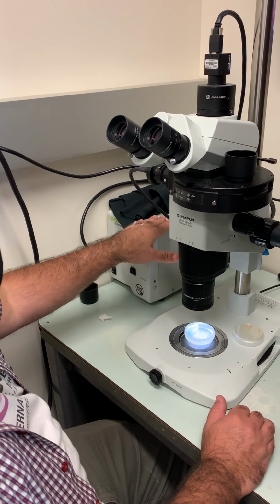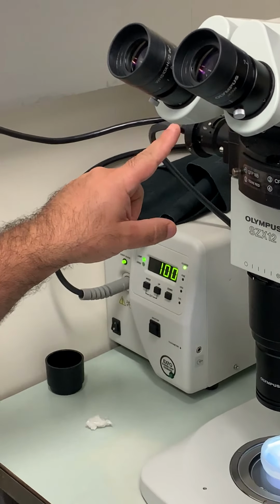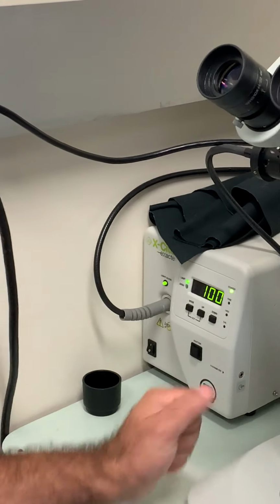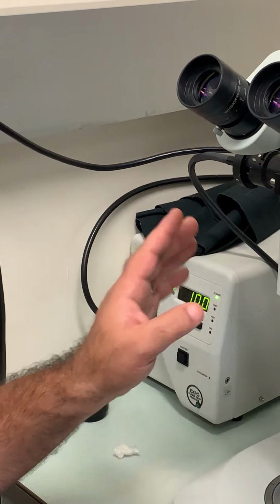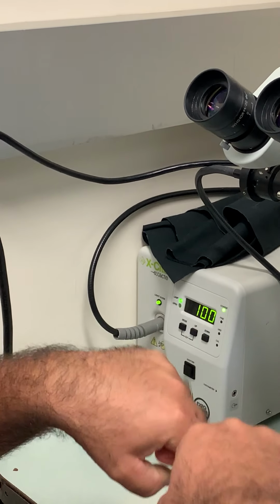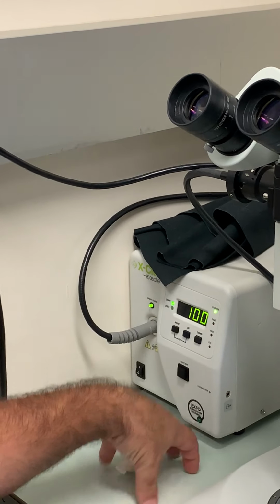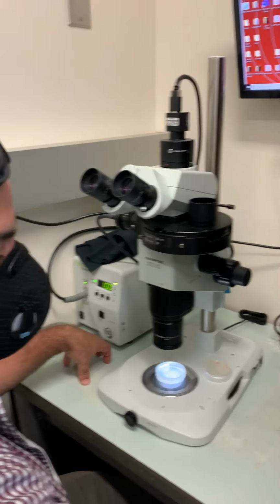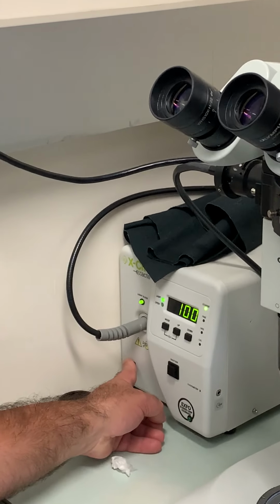Now if you're going to do calcium imaging, you're going to need a light source. This cable here is a fiber optic. It's made out of glass, and you have to be super careful not to bend that because it's $1,000, and if you break it, it breaks that glass. Never put an alcohol lamp in here. Keep your alcohol lamp on this side, and then you turn the power on here.